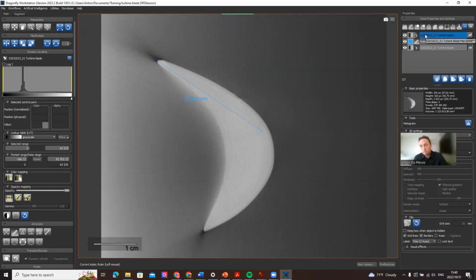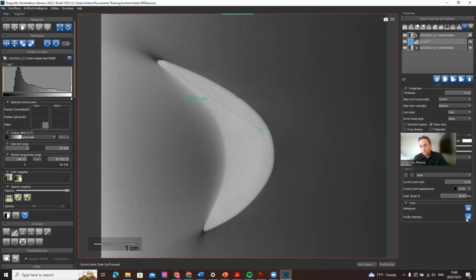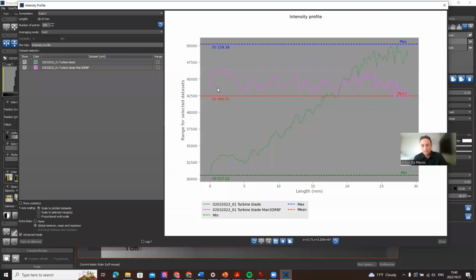I'm not going to suggest this is the best way, but if you click on the ruler and have a look at that, you have an increasing grayscale on the original data, but pretty much constant grayscale on the compensated data. So that's very useful for many applications, I believe.